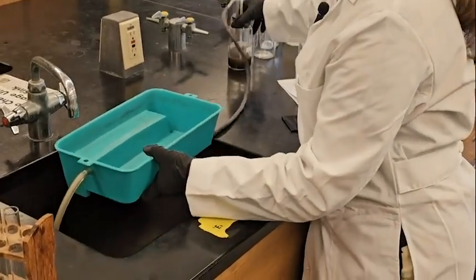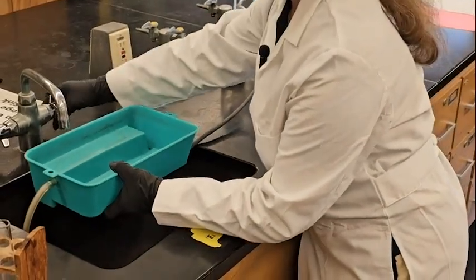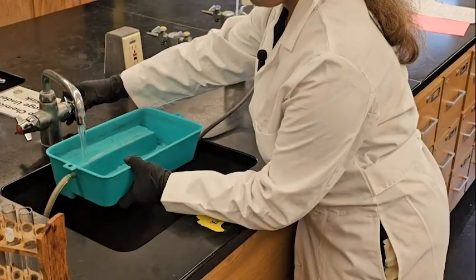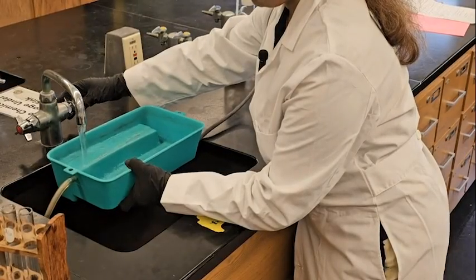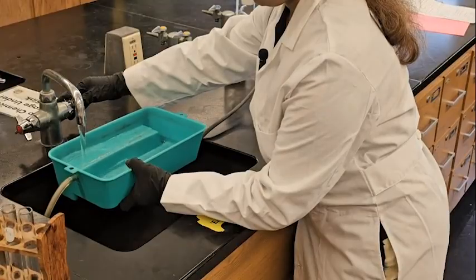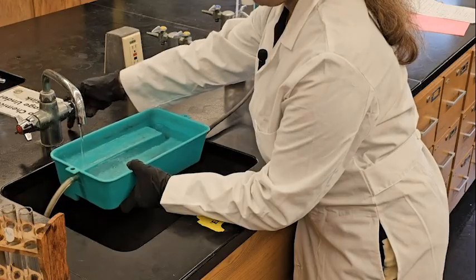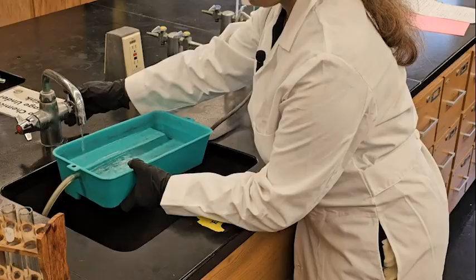Okay. I'm collecting tap water here. That's enough.